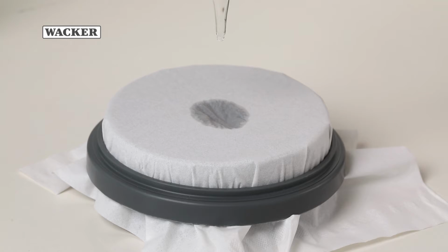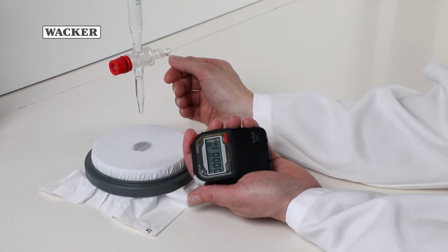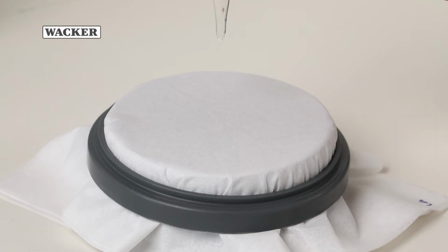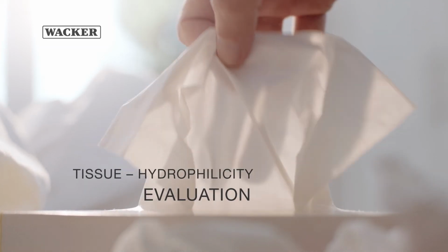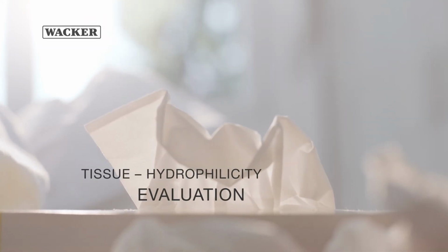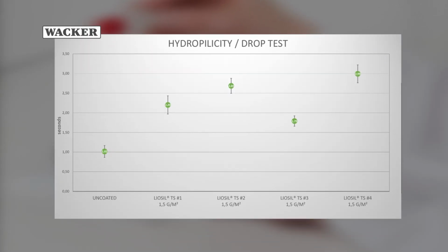Values of around 2 seconds, the time required for the drop in this video to soak in, indicate very good hydrophilicity. Do not continue recording values exceeding 30 seconds. Perform the test at least 5 times per tissue and visualize the results in a diagram, showing the average and standard deviation. The quicker the drop soaks in, the more hydrophilic the tissue is.